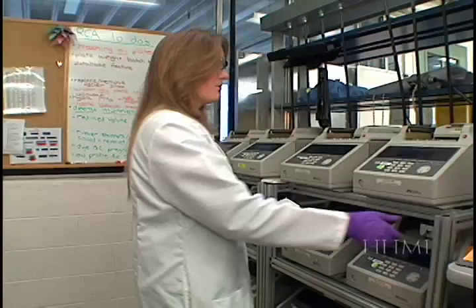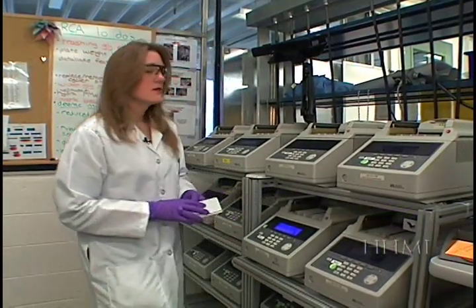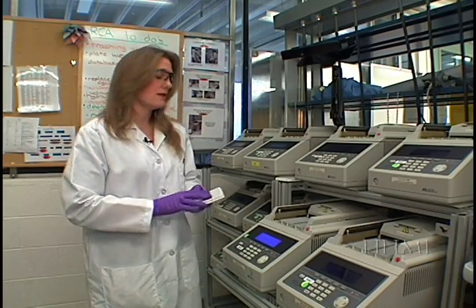Now we place the 384 well plate on the thermocycler. The thermocycler very precisely heats and cools each plate repeatedly.